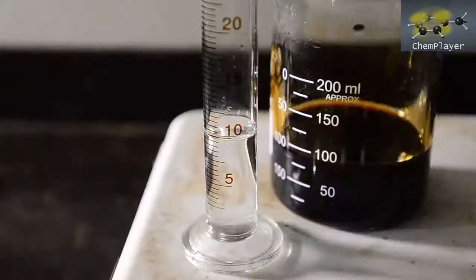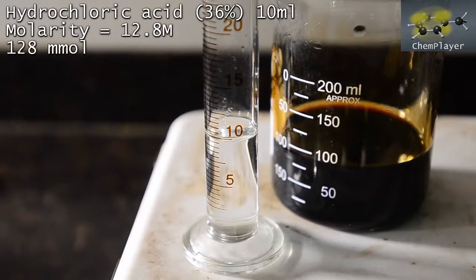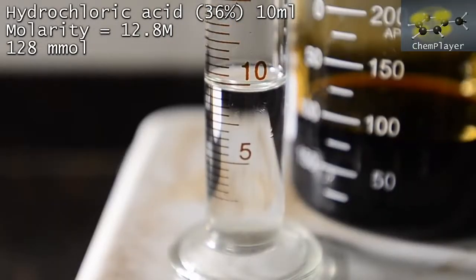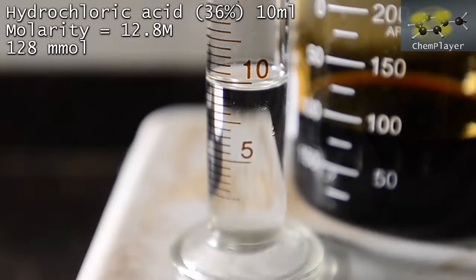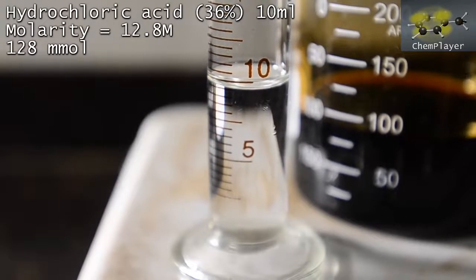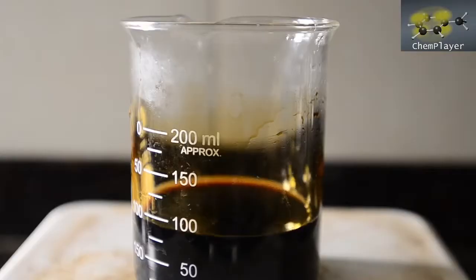And here we've got 10 ml of concentrated hydrochloric acid, which should be more than enough to bring the solution to neutral. We'll need to be careful not to over-acidify, otherwise the amine group in the p-aminophenol will form a water-soluble hydrochloride salt. So we'll need to check the pH carefully as we add the acid until we get to neutral. Let's get a bit in and start neutralization.